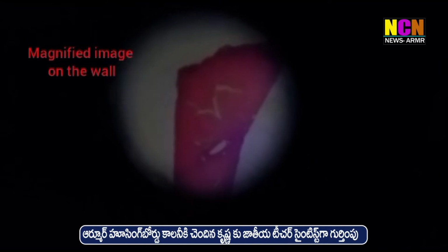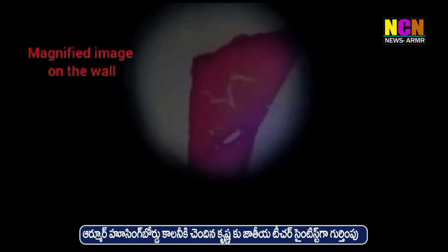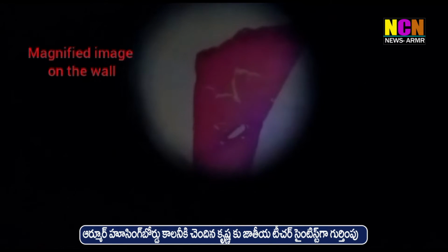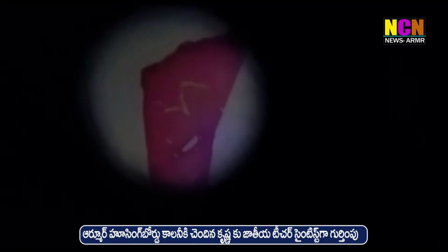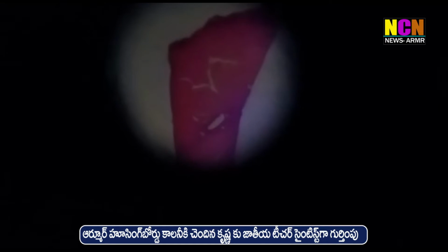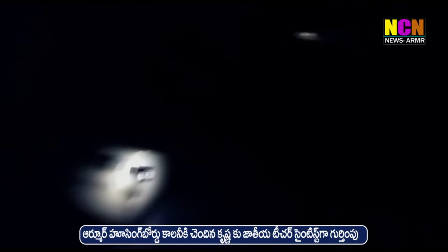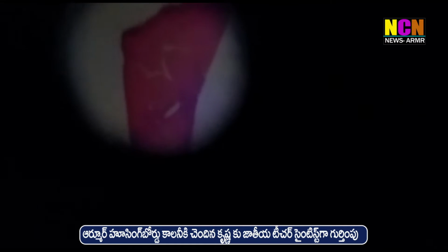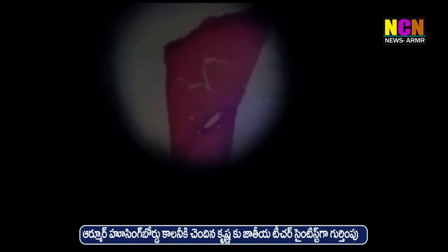If you place it like this, we can project the enlarged image of the slide specimen on a wall. So if you place it like this, we can show the specimen cells to the whole class at a time.